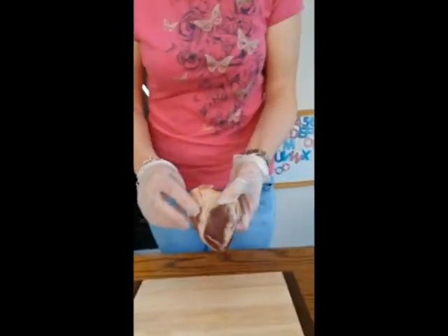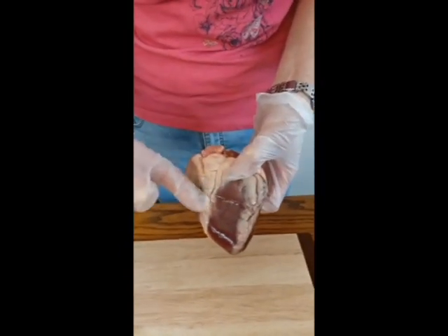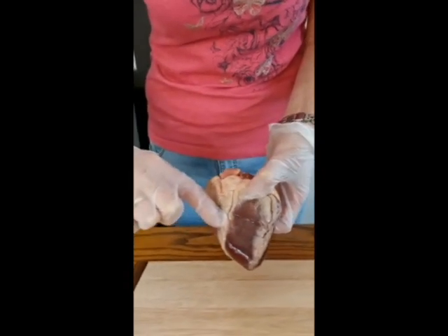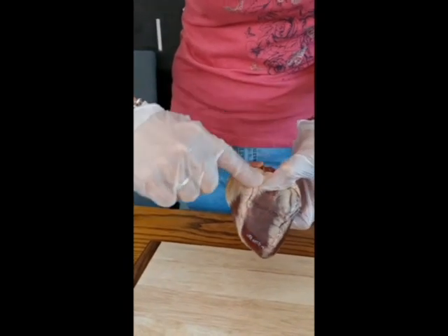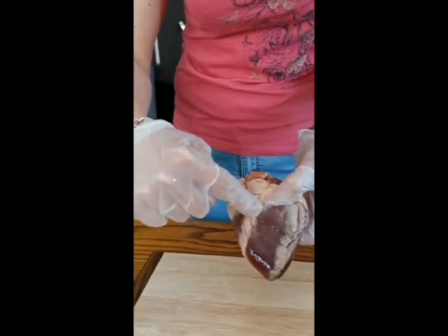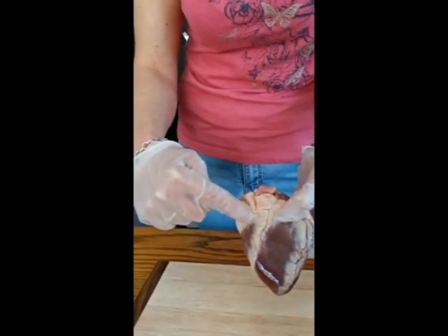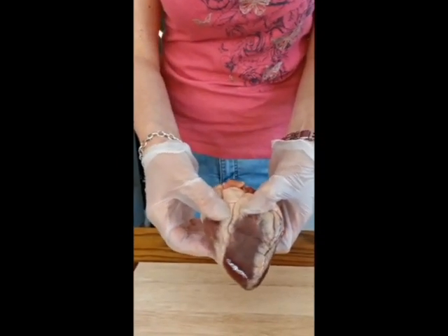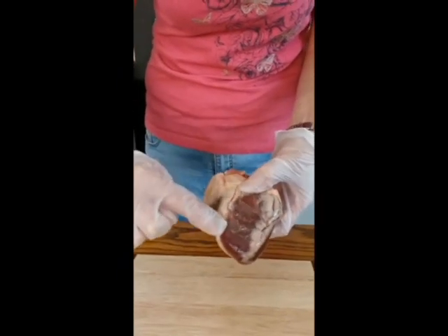Okay, so if you have a look at the heart here, you can see there's a line just where my fingers go in here, and this divides the left hand side and the right hand side of the heart. It's actually called the septum, that bit there. If you're born with a hole in the heart, this muscle goes all the way through from front to back, and you could have a little hole there that meant that the blood could go from the left hand side to the right hand side of the heart, and that causes a few problems because not as much oxygen is being delivered around the body as it needs to be. So when you do a dissection you look for the septum.